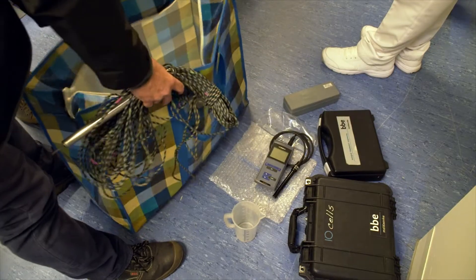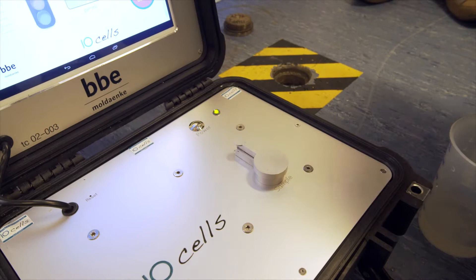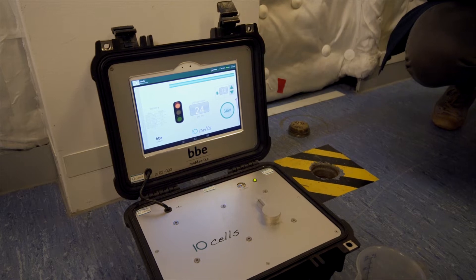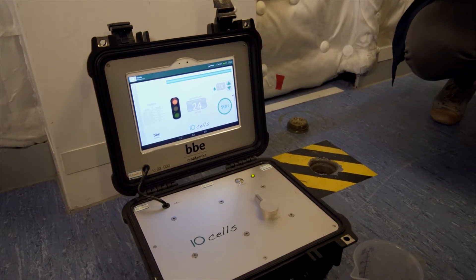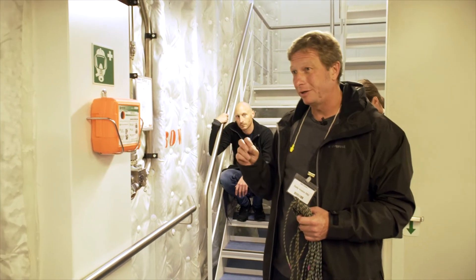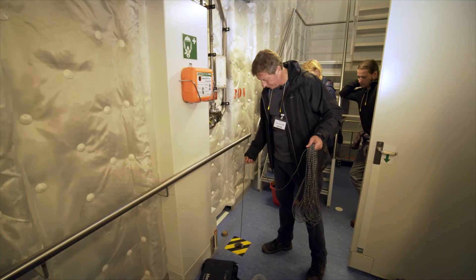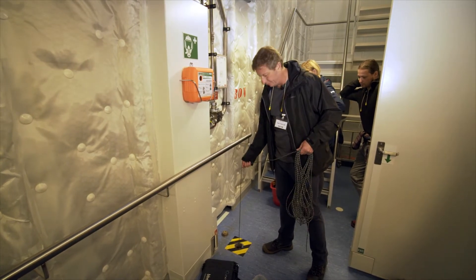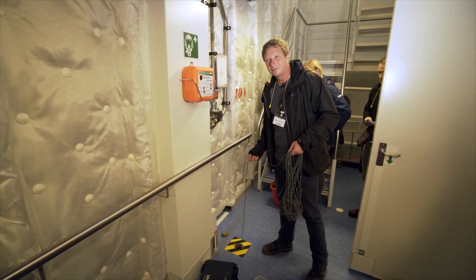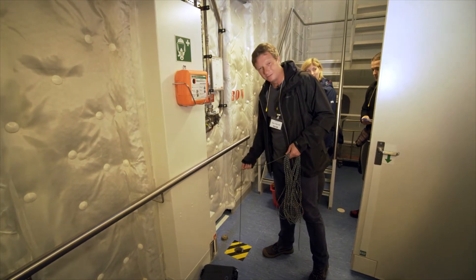This one is simply a refractometer for salinity — these two are for salinity. This one is specifically developed with ten cells because of the standard in ten cells. This one indicatively calculates the concentration of phytoplankton in the 10 to 50 micron range. We should be somewhere in the water now, on the top. It's a little bit like fishing because the valve jumps up and lets the air in — it is in the water.